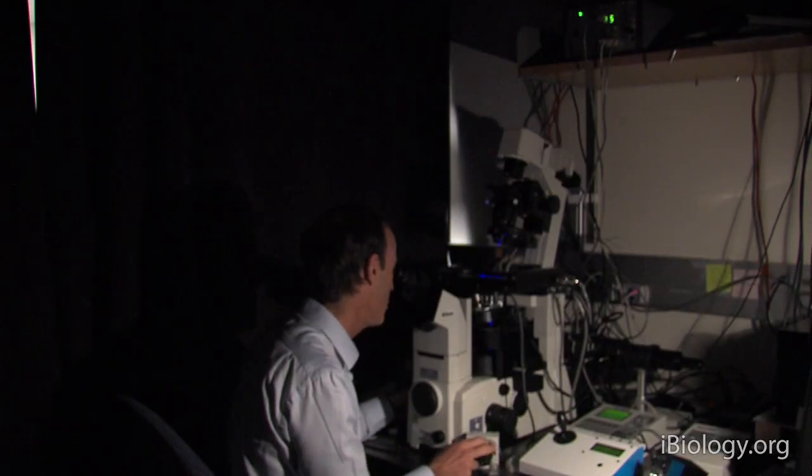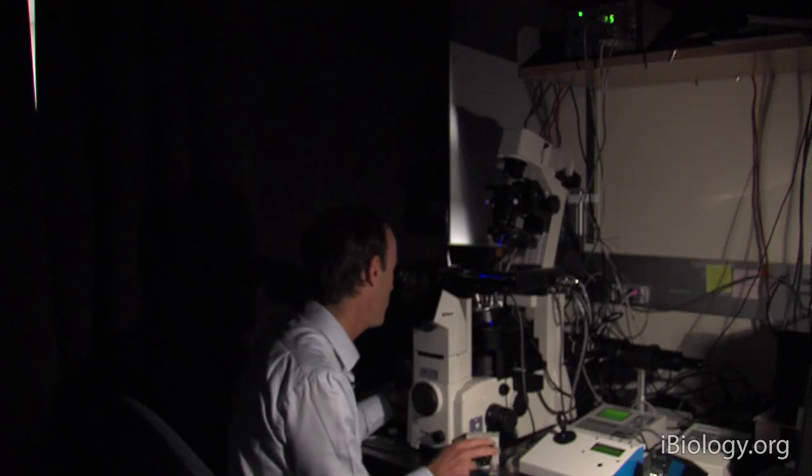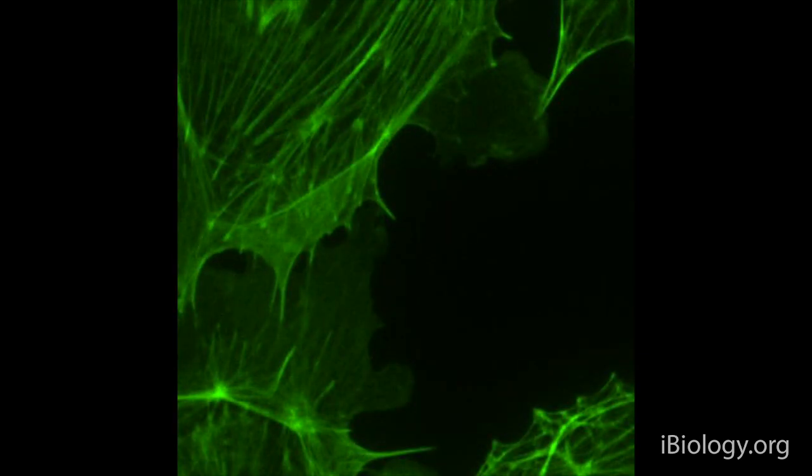And now I'm going to the fine focusing device, so I can now bring the cells into crisp focus. And that's it. And now I'm ready to do my experiment.